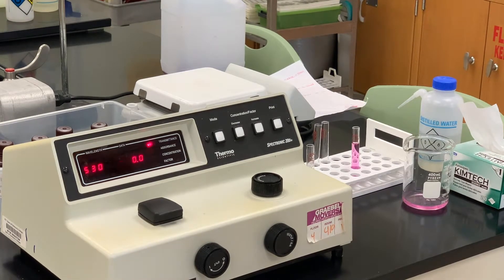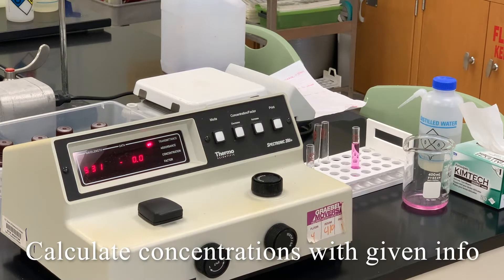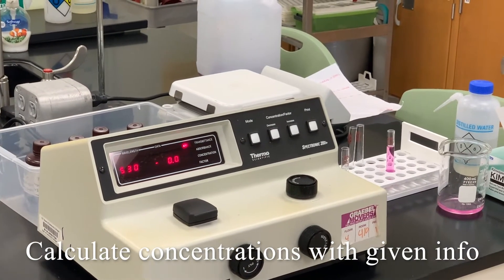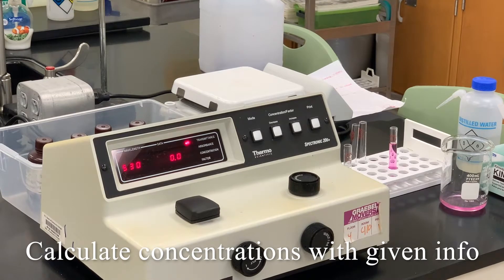So now what we're going to do is that we're going to take six different solutions. The concentrations of these you will find in the lab data that will be on Blackboard. So you'll have these concentrations I'm just going to call these solutions one, two, three, so on and so forth.